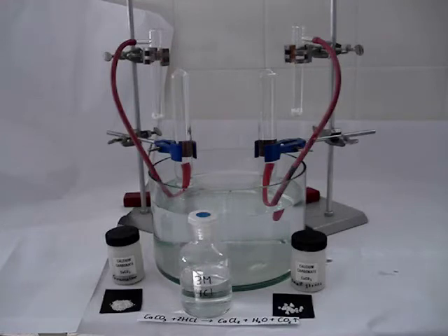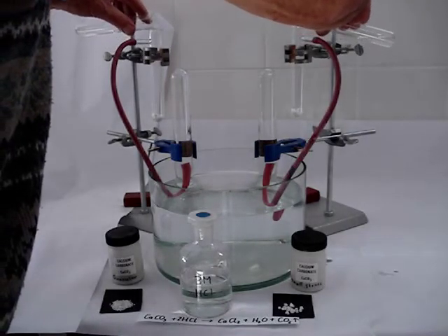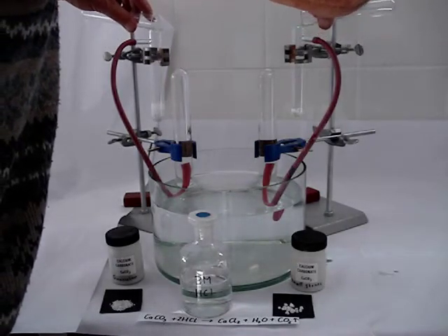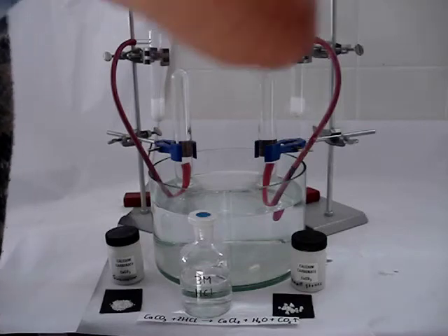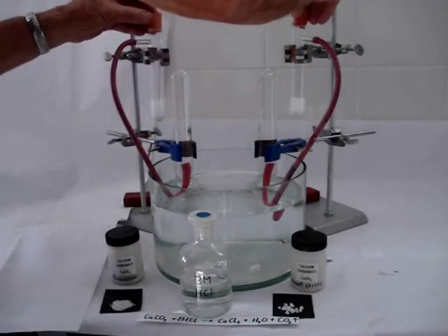Now we add hydrochloric acid to each of them simultaneously. We add the same quantity of hydrochloric acid and the same concentration. We put on a test tube stopper.